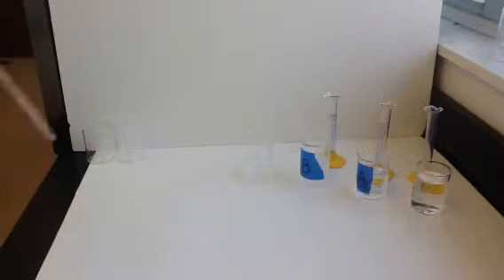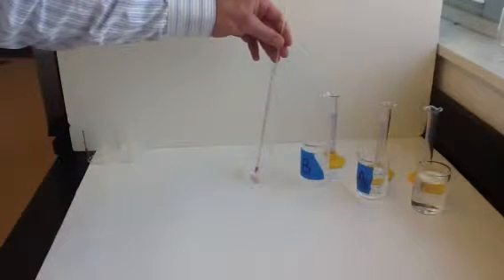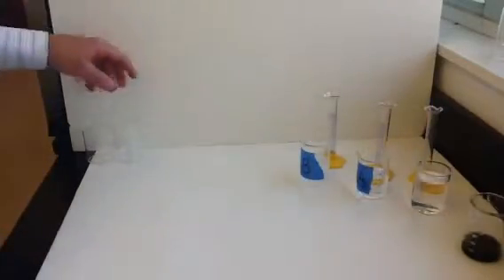These are reacting at room temperature, and so today that's about 19 degrees for these two things. So 19 degrees, this is the first trial with 10 milliliters of A and 10 milliliters of B. And there, the reaction just happened. You saw the color change, and so now you would stop your stopwatch right when the color change occurred. And now we're going to do some other trials with other concentrations.